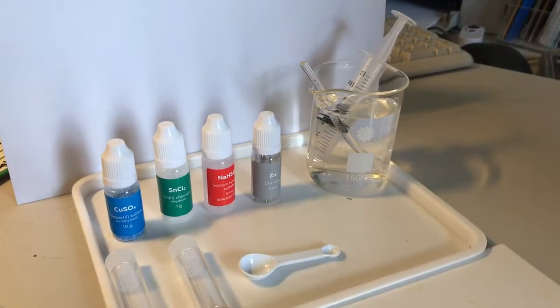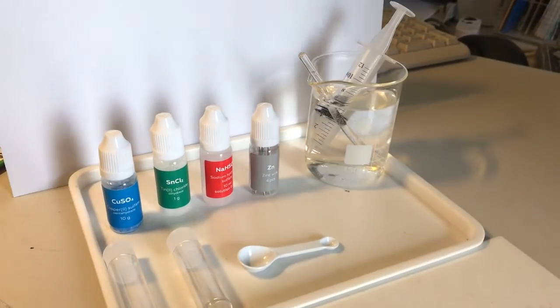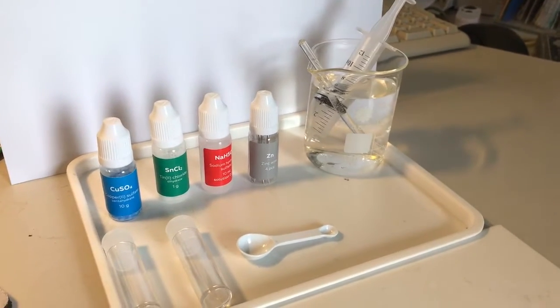Hello. Today we will be looking at another MEL chemistry experiment where we will test the reactivity of metals.